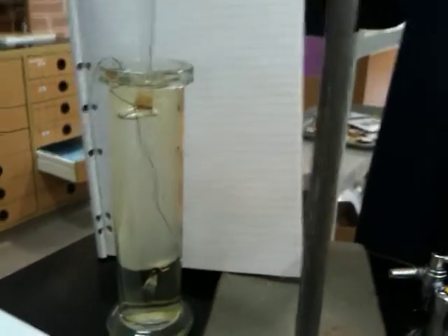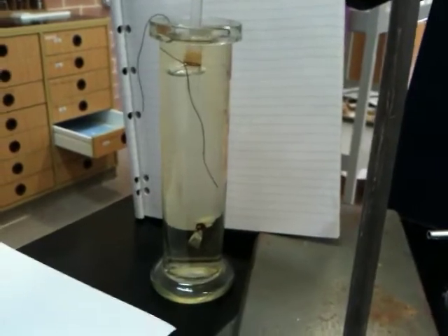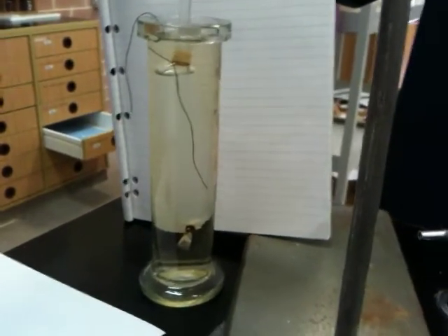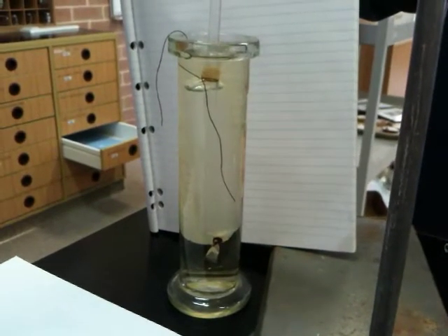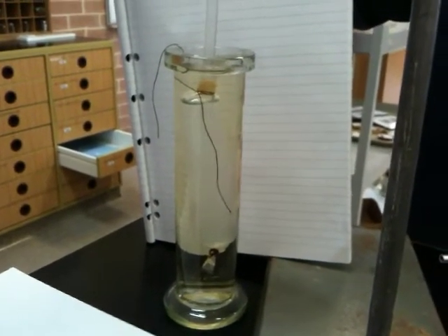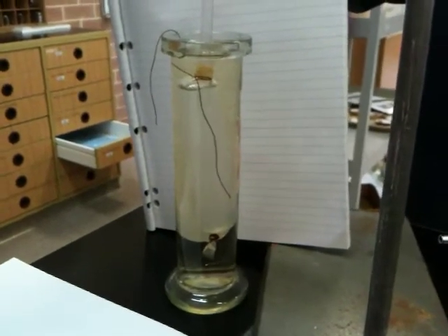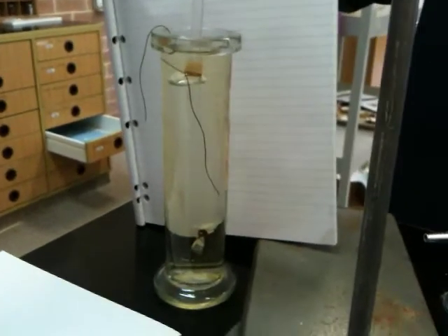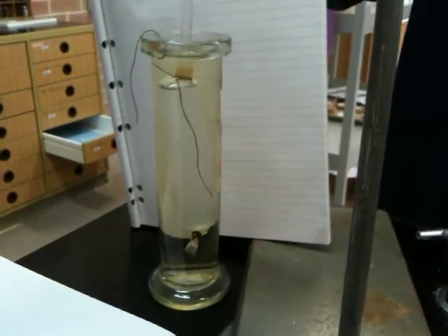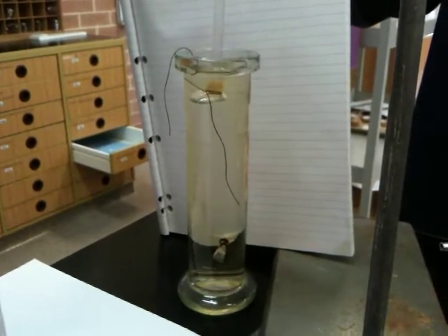Okay, so we're here with Group 1 at school, and we're in biology class, and we're studying cell membranes and the difference between diffusion and osmosis. So currently we've set up a what sort of system? So what have we set up? A system to test osmosis. Yep. So the purpose is to observe and compare examples of diffusion and osmosis.